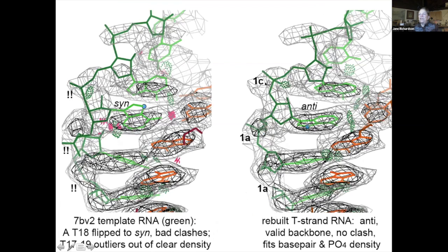And then some changes in RNA where this just didn't fit the density very well. This one's backwards. It's a syn purine when it should be anti. I mean, not that they're not sometimes syn, but clearly this one shouldn't be. And then they have these, we call bang bangs. Our backbone conformers for RNA are number letter code, and exclamation points mean that it's an outlier. And when it's rebuilt, you get named conformers, and this is really a pretty good A form.